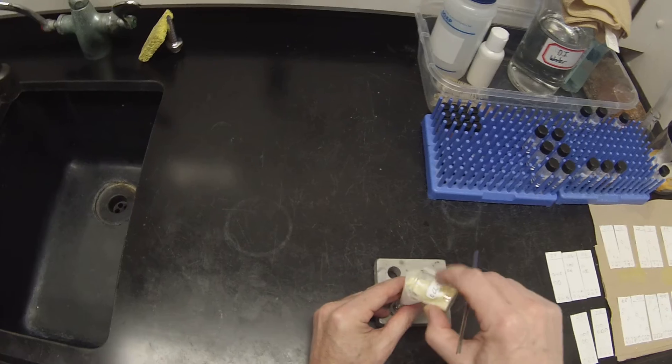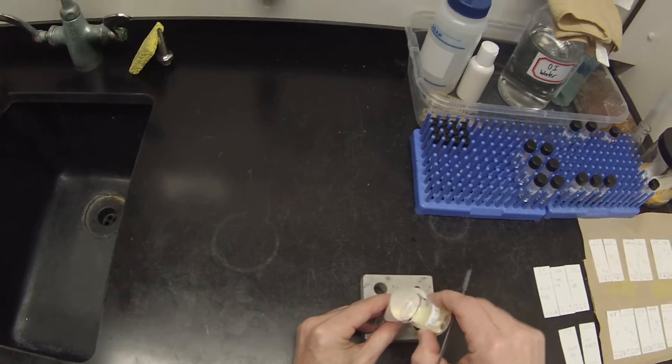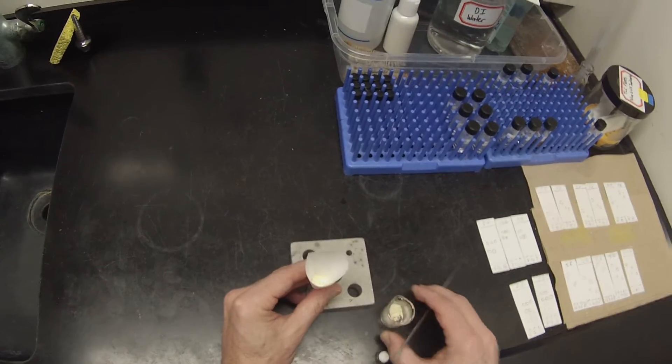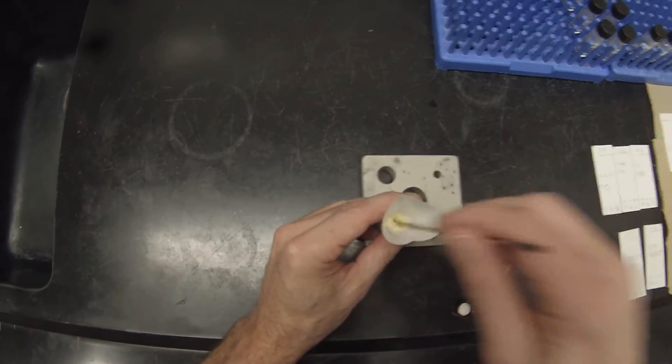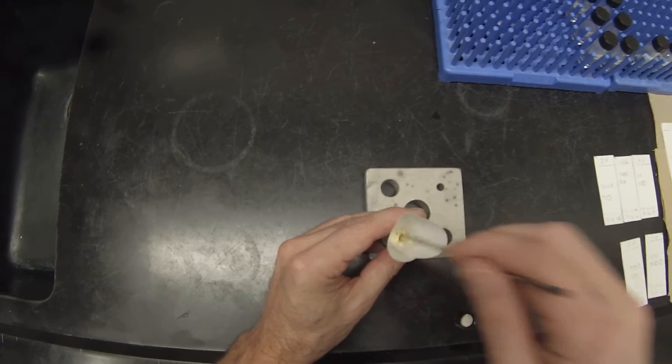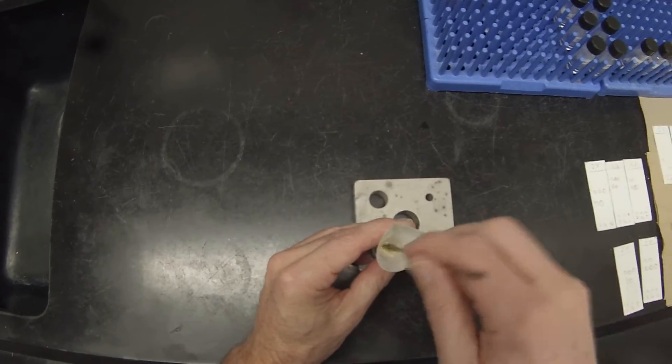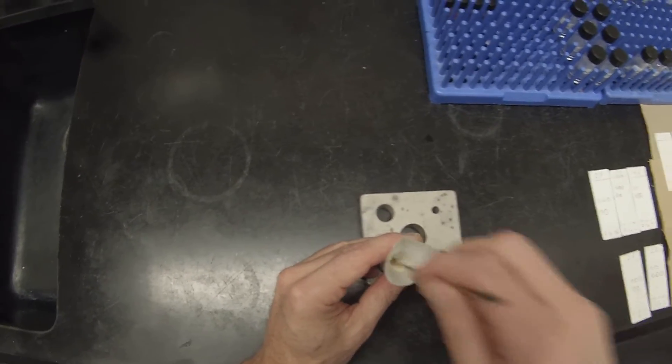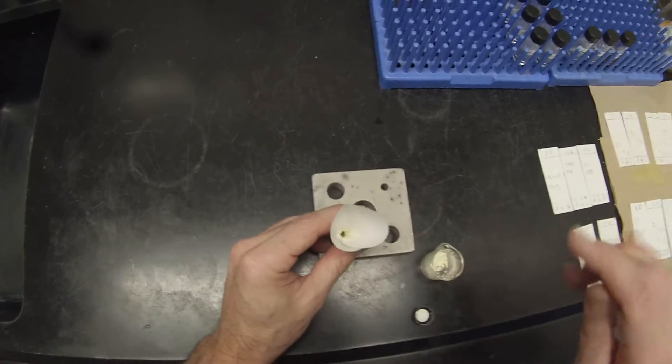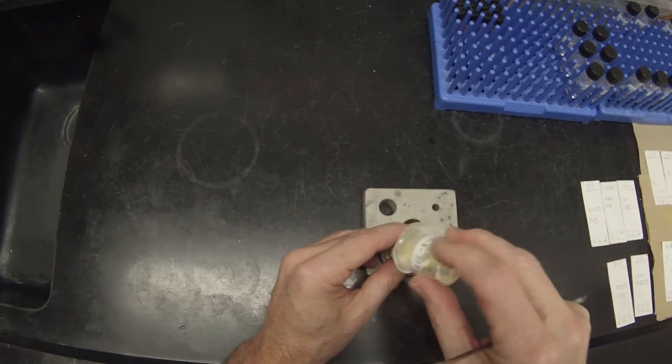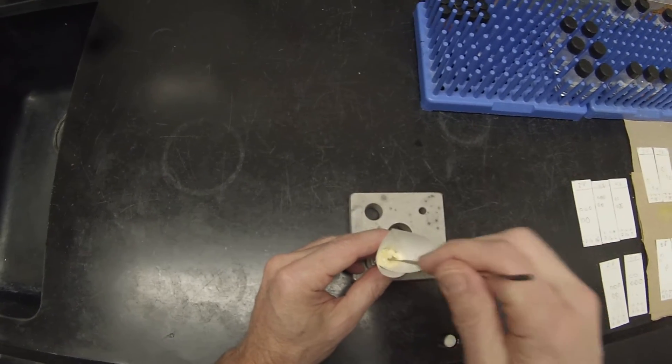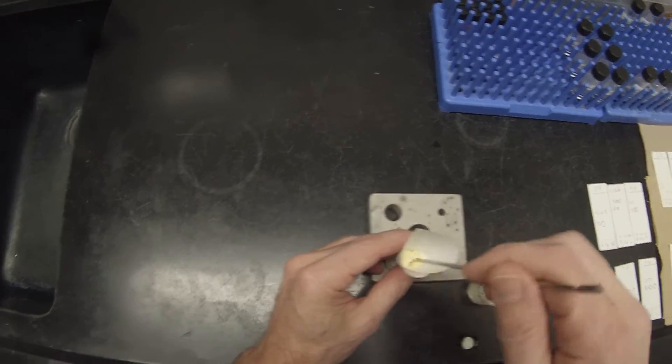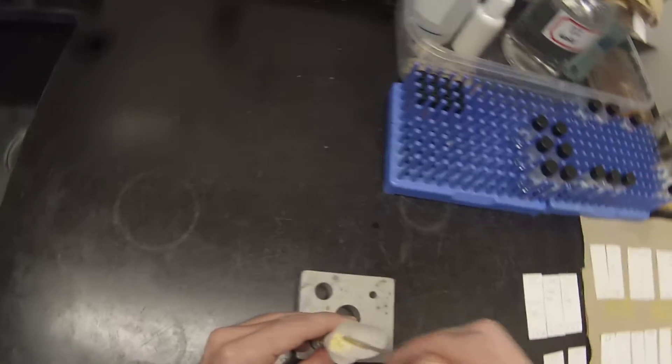I'm just going to dump that in there. Kind of help it through with the spatula. It's not an entirely free-flowing solid. It's a little bit sticky. It's going to pretty much fill that vial. Got a lot of it.